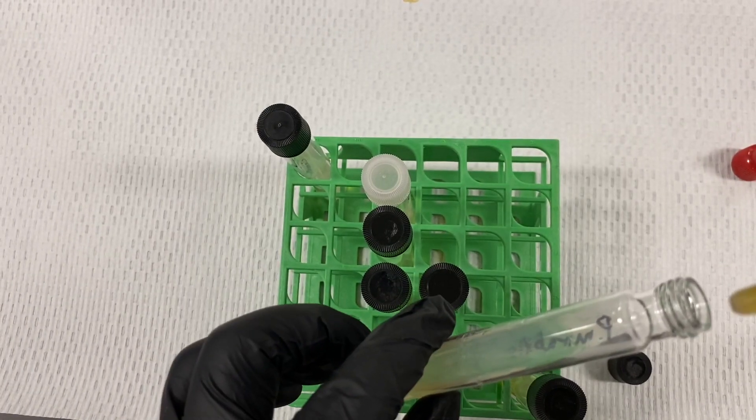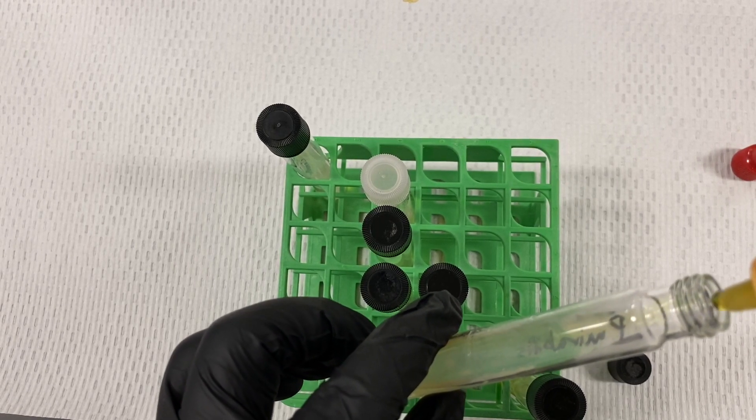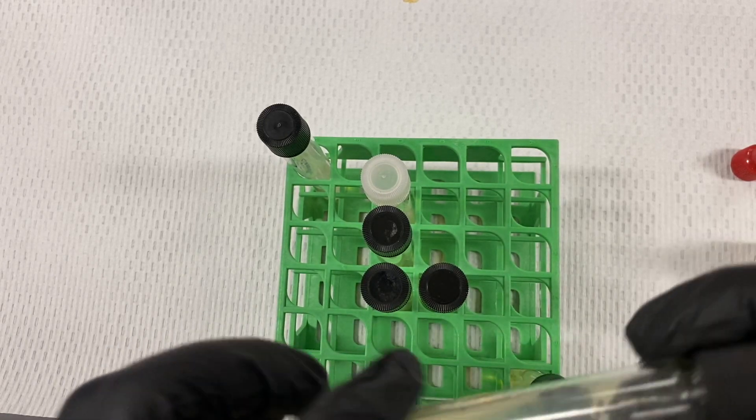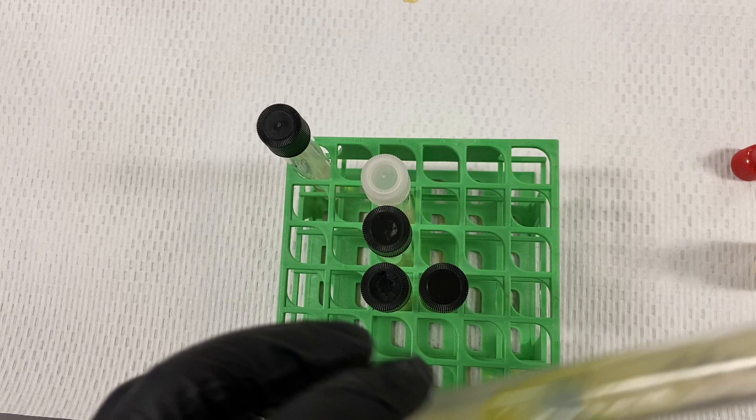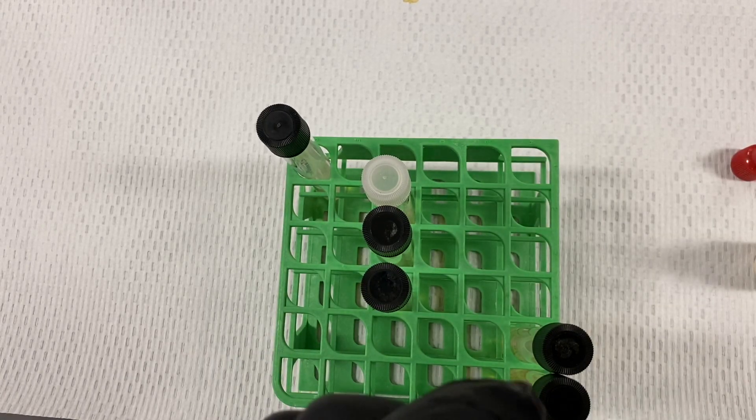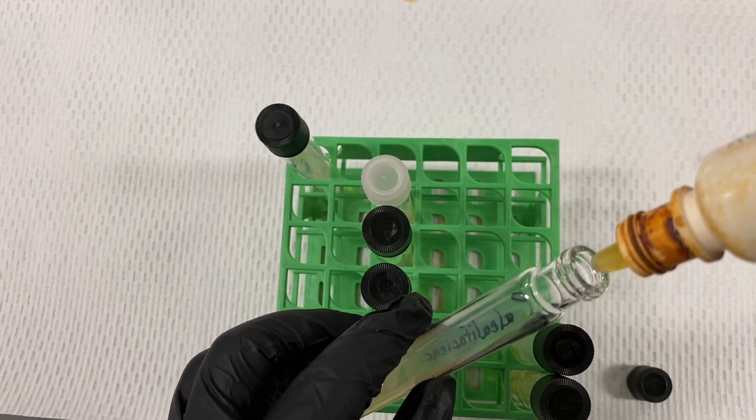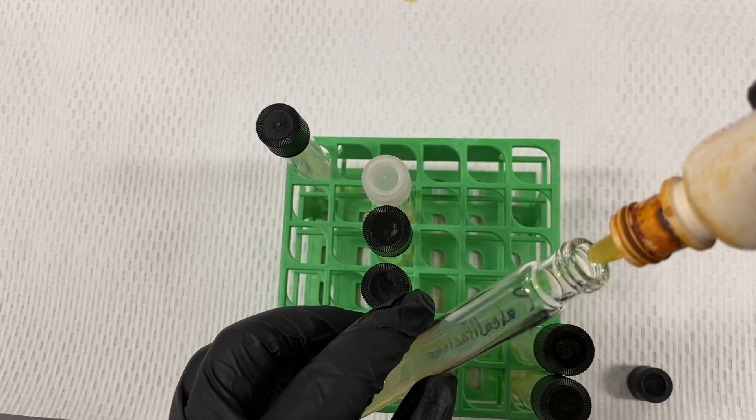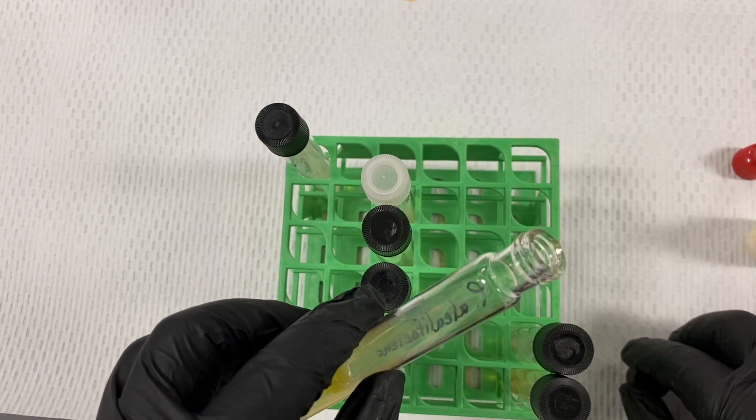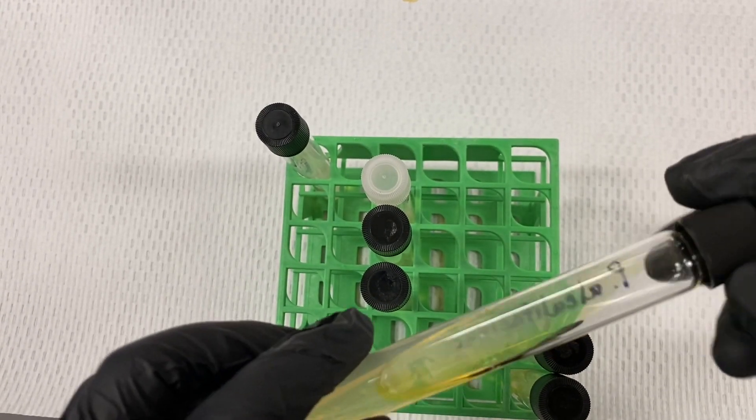Again, being careful without touching the tip, five drops, close it, and rotate around its surface. Our last one: five drops, and then allow it to cover the surface.